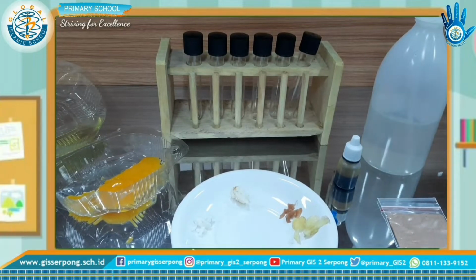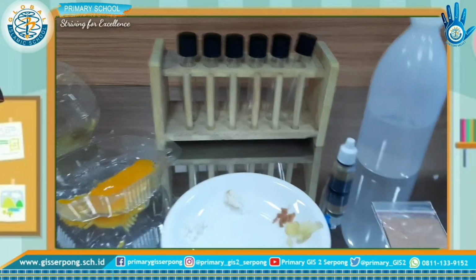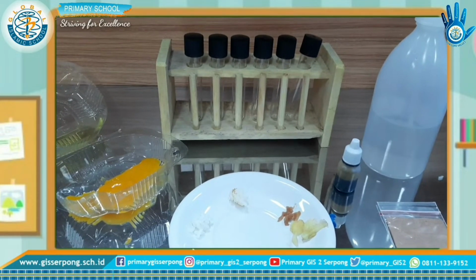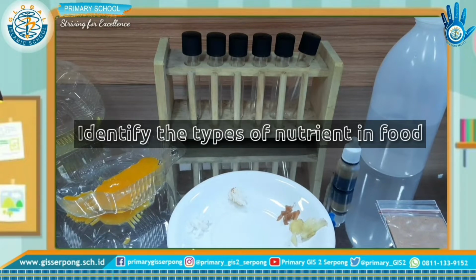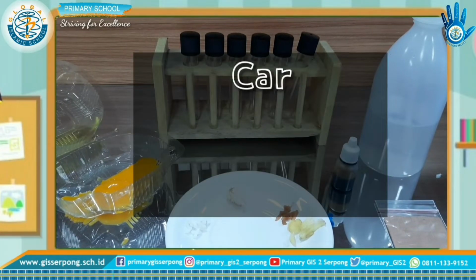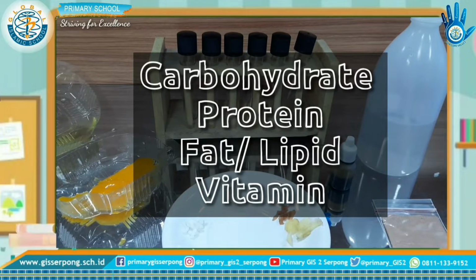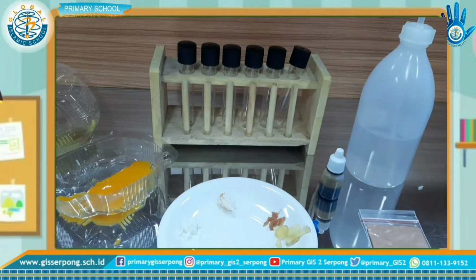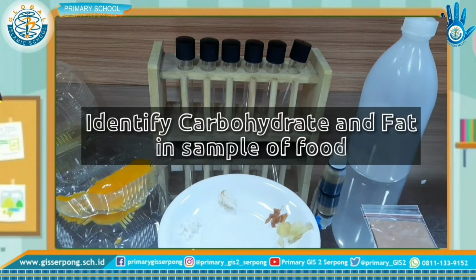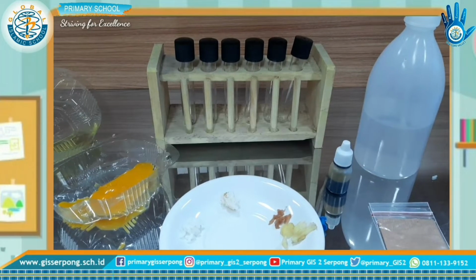Today we are going to learn about food. So the practical science now is food test. With this experiment, you can identify types of nutrient in food like carbohydrate, protein, fat or lipid, and vitamin. But for this experiment, we only identify the carbohydrate and fats.